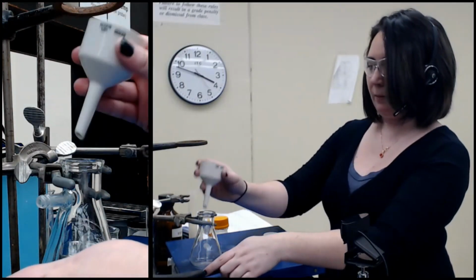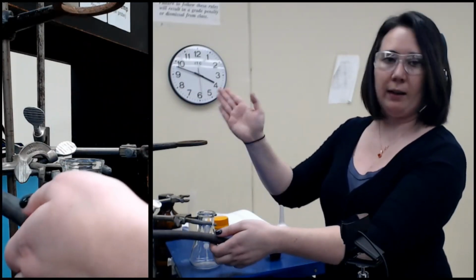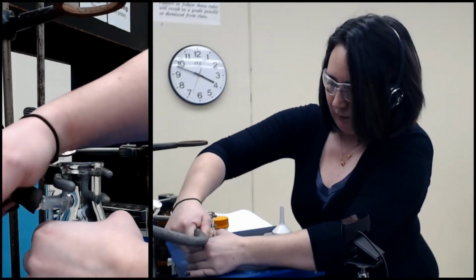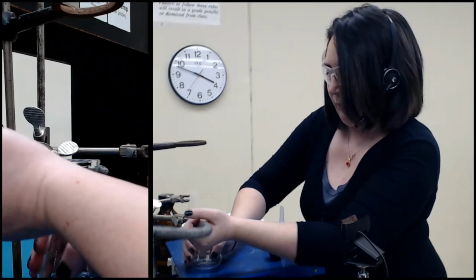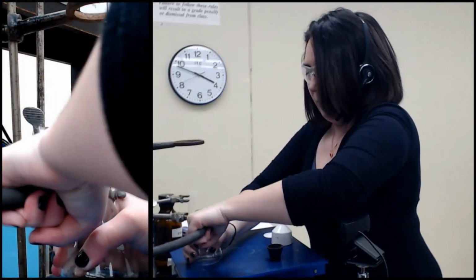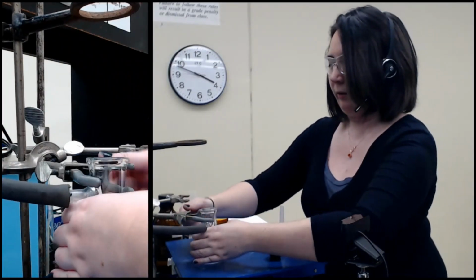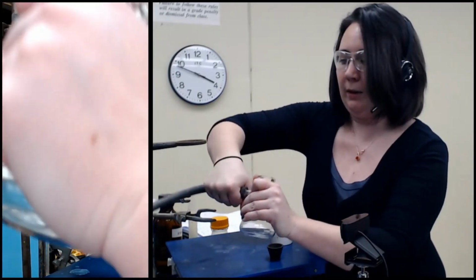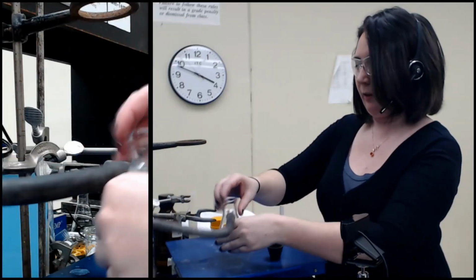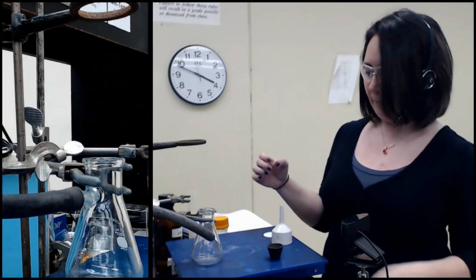I have set everything up on top before and then gone to do this and literally slapped the whole thing away. Doing the hose first might be easier, in fact, and then once it's on there, clamp it. That's totally fine too, because the whole point is you just don't want this to go away.